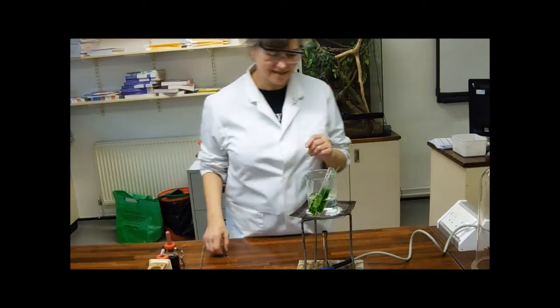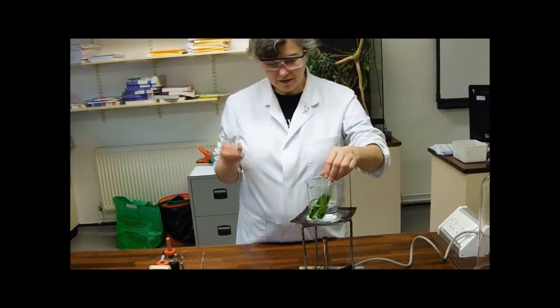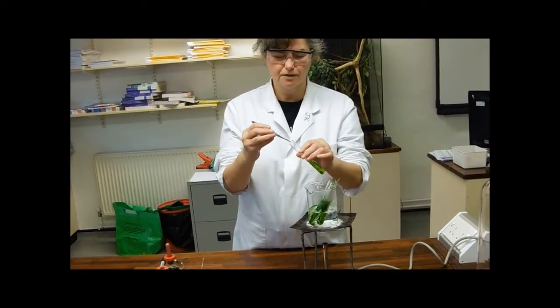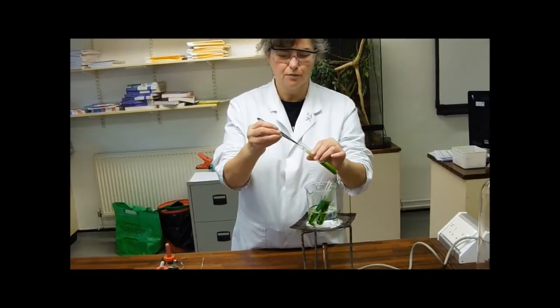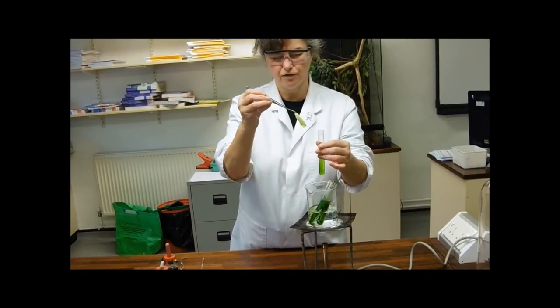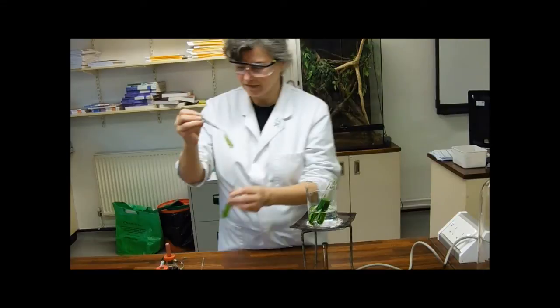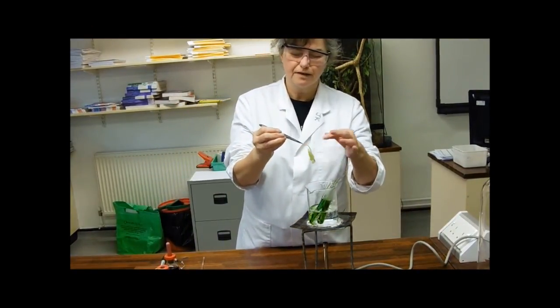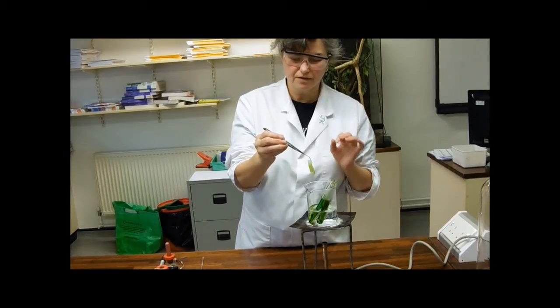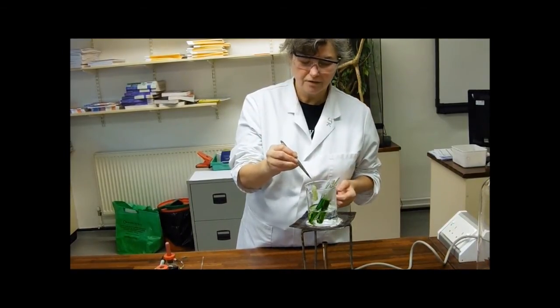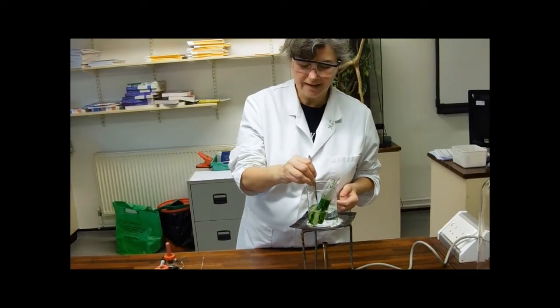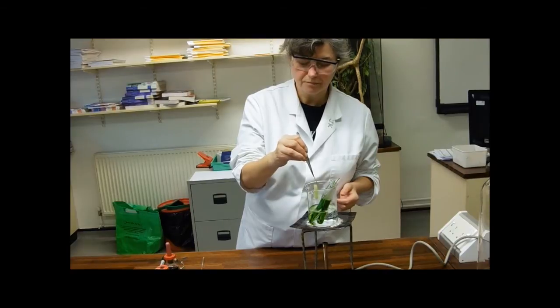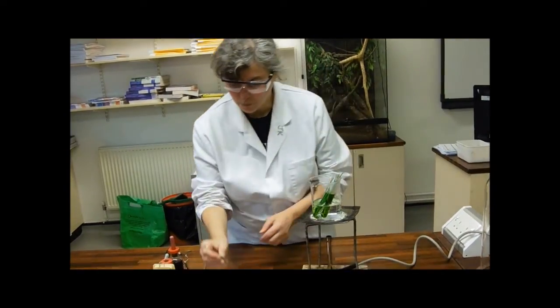Okay, we're back on the case. I'm going to start with the variegated one, because that seems to have lost most of its chlorophyll. So what we're going to do is use my forceps, grab hold of the stalk and pull it out. And you can see that the chlorophyll has been left behind. And I've got a lovely, almost entirely white leaf. They are quite stiff when they come out, because of the alcohol dehydrating them. And so the best thing to do, because you want to spread it out to have a look at it, is to dip it into the hot water. And that will make it more spreadable.